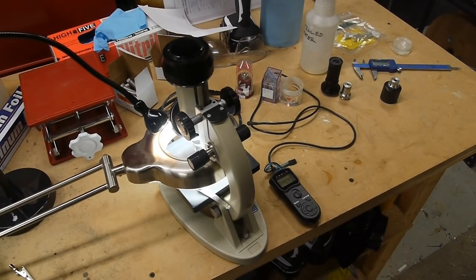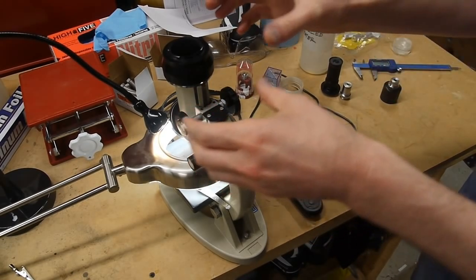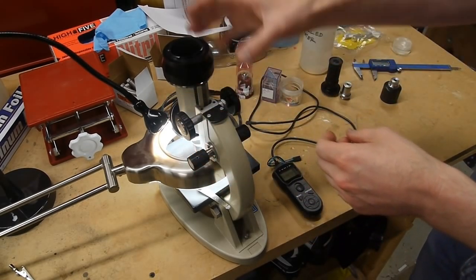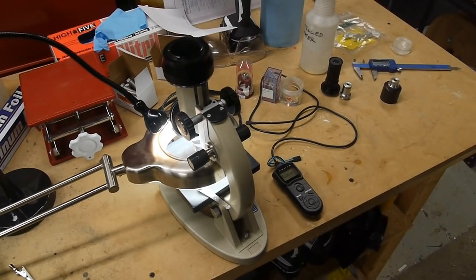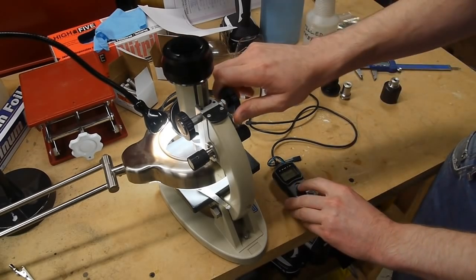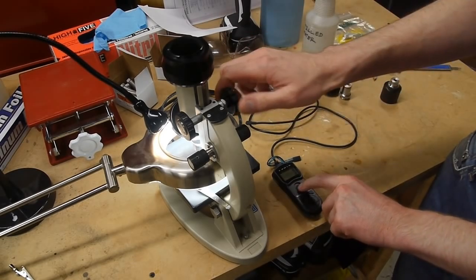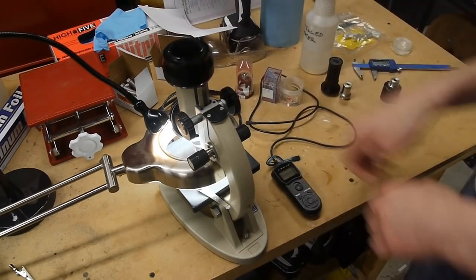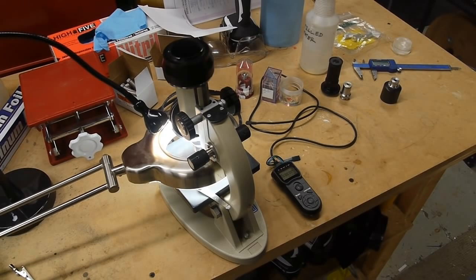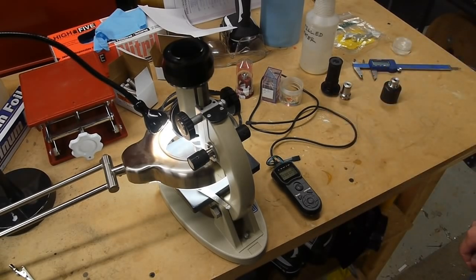There's a couple other bits of kit that help with this setup. One is a remote shutter release. So if you move the camera a little bit between frames, you have to do a lot more work later on in software to align all of the images. So one way to avoid that problem is to not touch your camera at all and just, you know, take a picture and move this down a bit, take another picture like this, and eventually you can collect a whole stack pretty quickly that way. Also, you want to make sure your camera is set on manual so it doesn't change the exposure on you as you're going up and down this way.